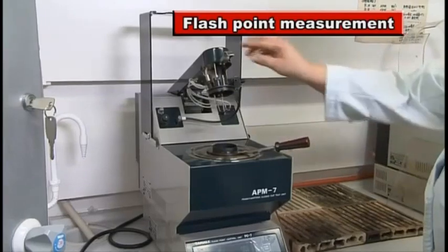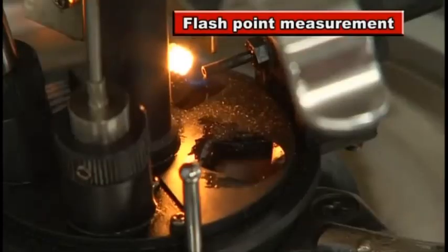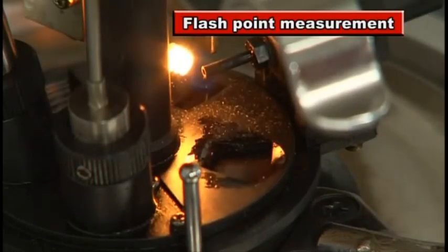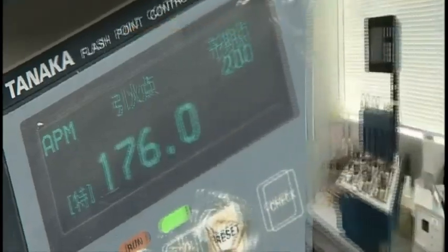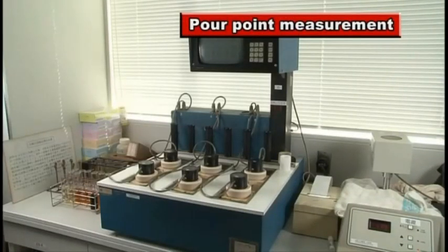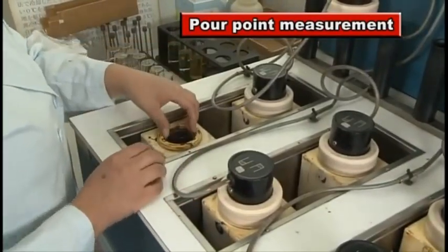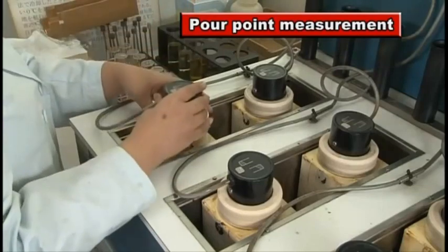Flash point measurement. Pour point is an important indicator when transporting and storing fuel in cold regions.